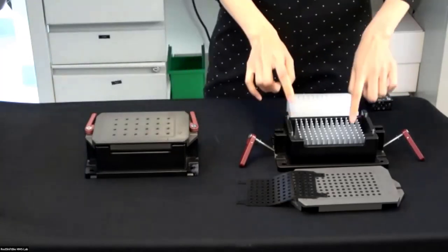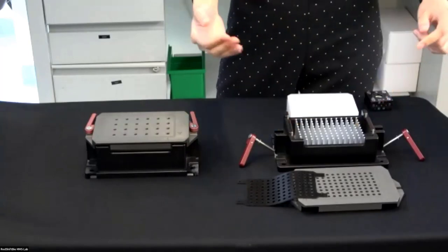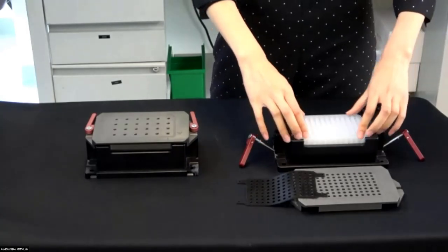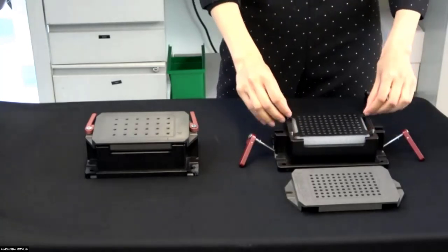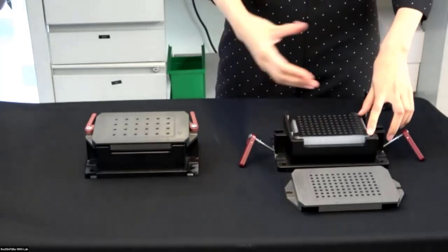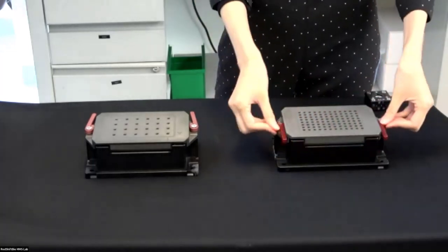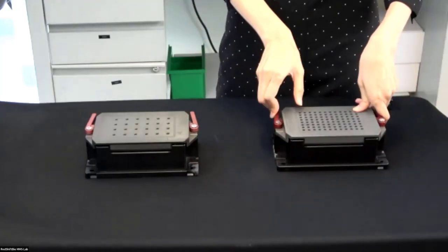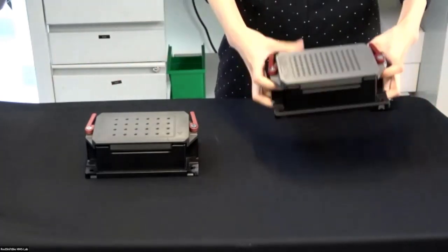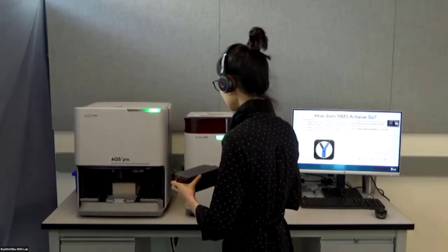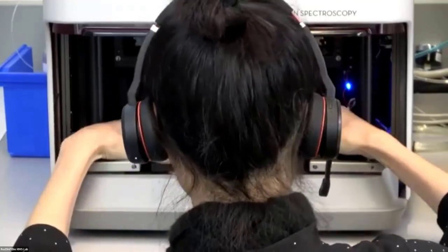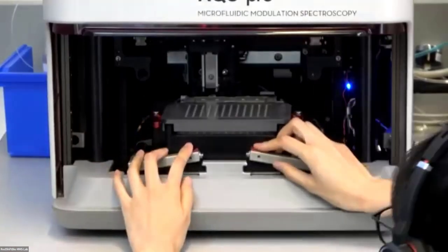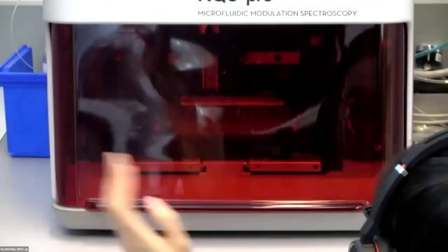For the 96 well plate, you can see here is a chiller to lower the temperature if you want during the measurement. You can put in the plate. By the way, the rubber gasket, we have different options. There's one to avoid evaporation. Again, if you really worry about evaporation, we have another gasket to do that. We assembled the plate holder and now it's ready to be placed into the system. In the system, we have an aligning pin. This carrier has some weight and you will just secure this carrier and then you can leave the door open or just close it.